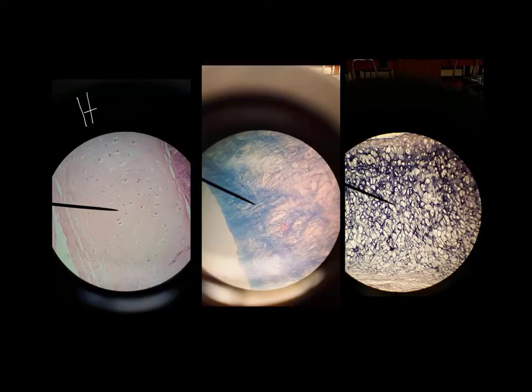The fibers in hyaline cartilage are not easily visible. They're there, we just don't really see them, and under a microscope, hyaline cartilage, I've always thought, kind of looks a little bit like stained glass. Now again, just like we saw back with our first lab or the first of the tissue labs, I believe it was lab 3, don't learn colors, because colors can change from slide to slide.